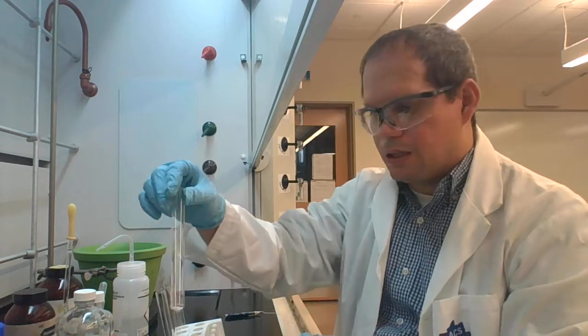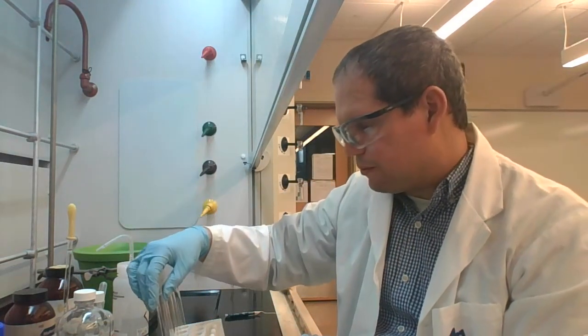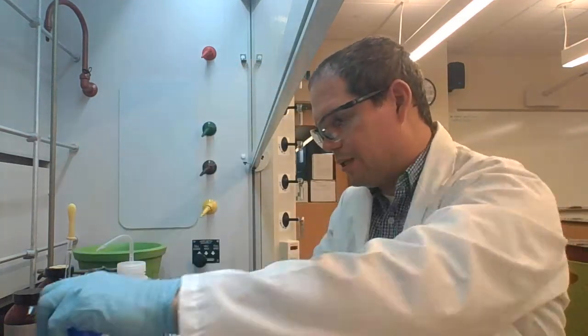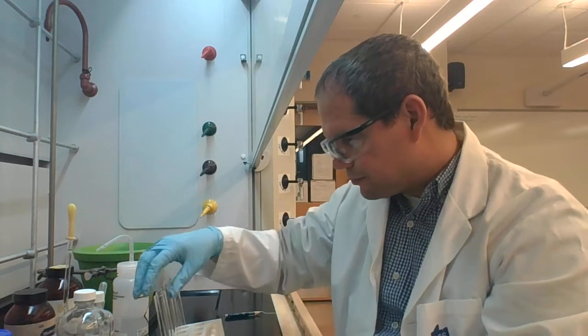of fluorene. So here is test tube 1. There's roughly about 50 milligrams in there. And fluorene, notice the spelling, so it's not spelled the same way as the element fluorine. So this is an organic compound made primarily out of carbons and hydrogens.